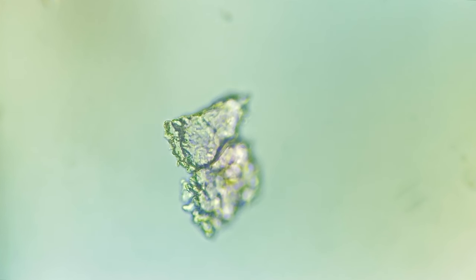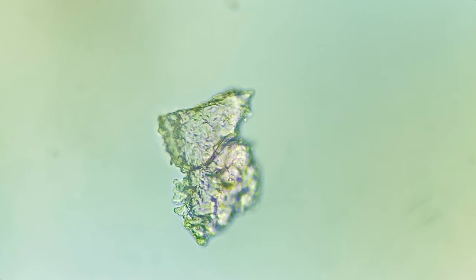And with both samples now released onto a glass slide I was faced with a choice. Do I finish the extinction process and eradicate these samples? Or do I give them a second chance?